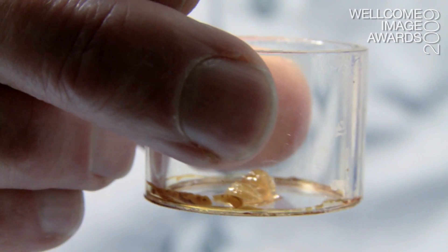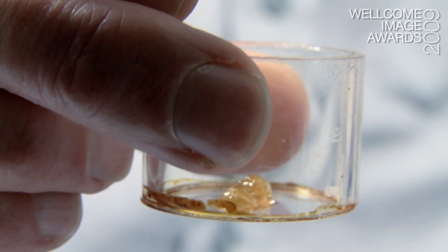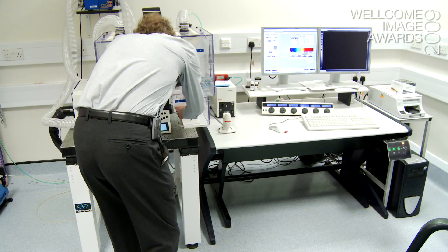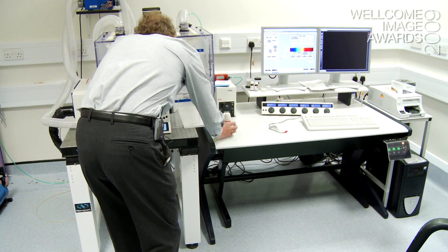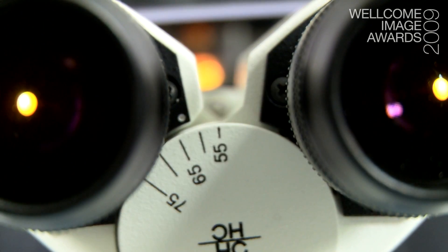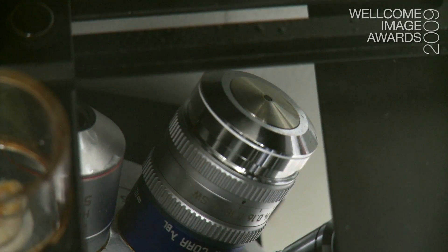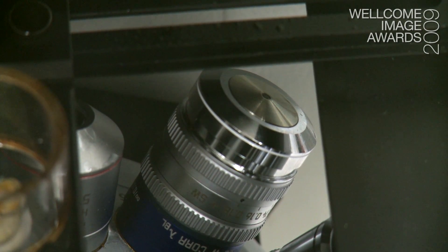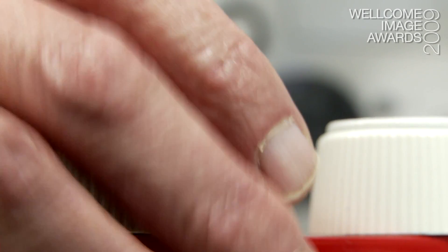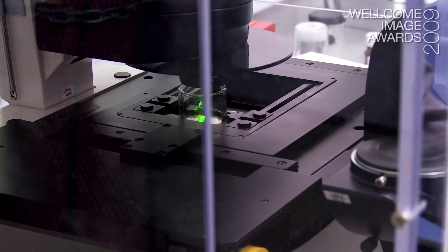The tissue you get will arrive probably on a microscope slide, maybe in a dish which you put onto the microscope. You would probably view it through the microscope first of all, just to orientate yourself and get the sample in the right place. You will then choose the laser or lasers that you're going to use to excite the sample.